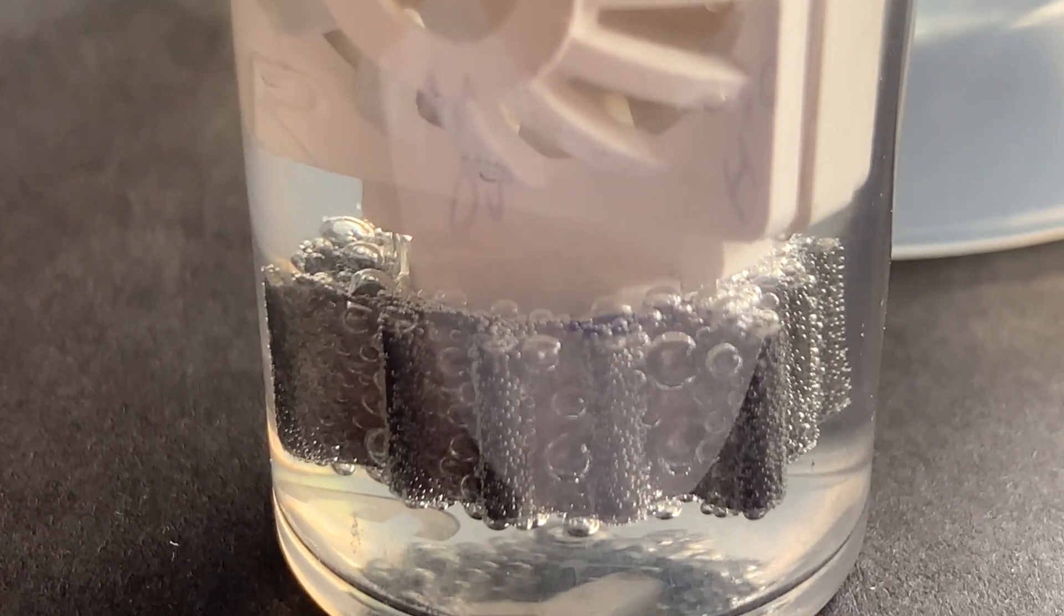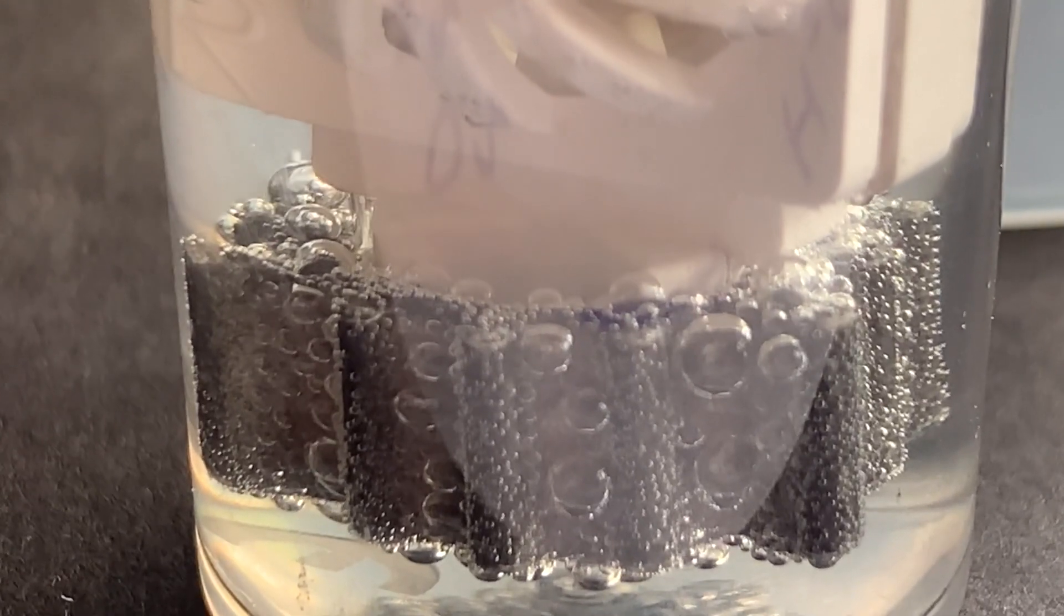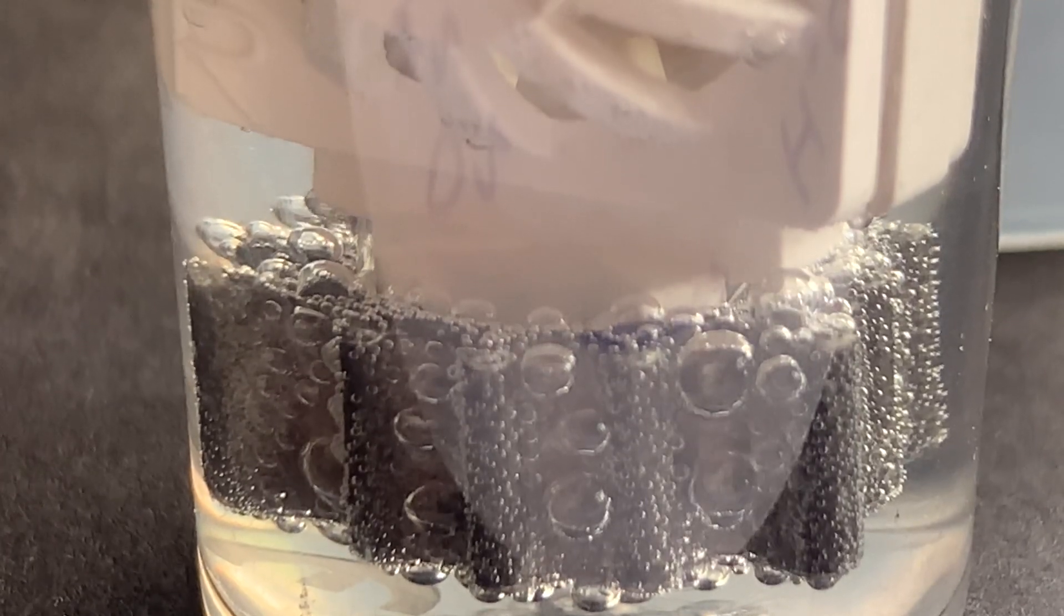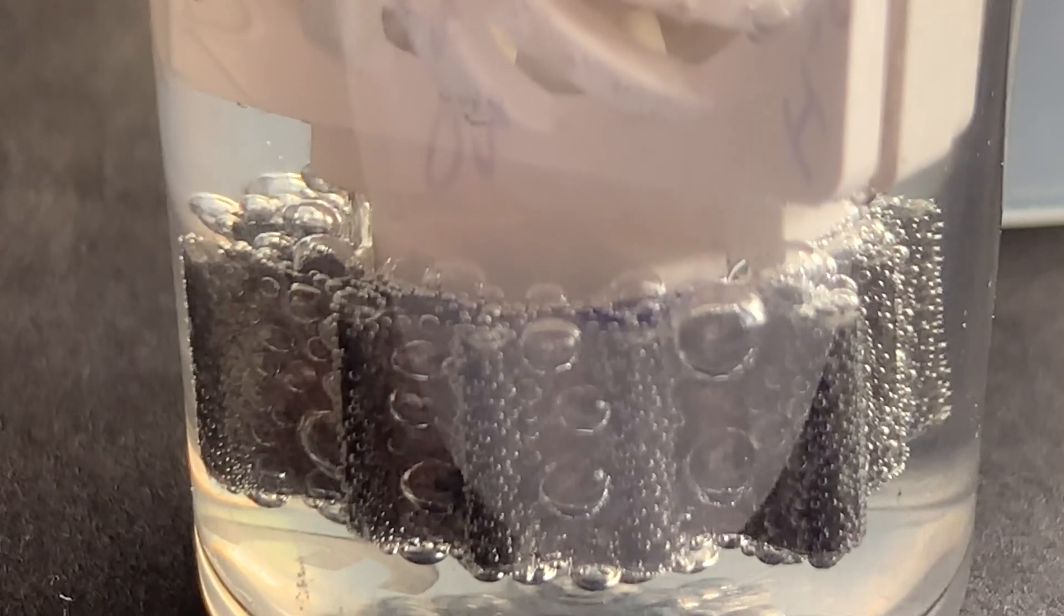I believe the metal that's doing this catalysis is platinum. Oh, here come the bubbles. You can really see them growing and growing. They're not rising yet. Perhaps they're not big enough to be buoyant enough to break off of the metal themselves.